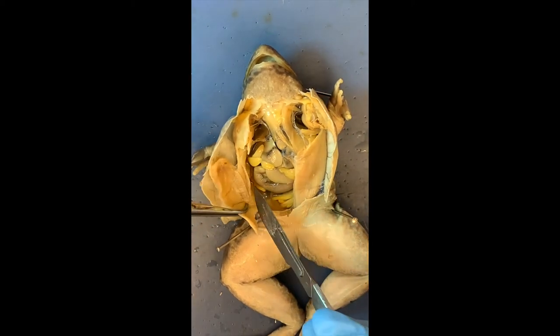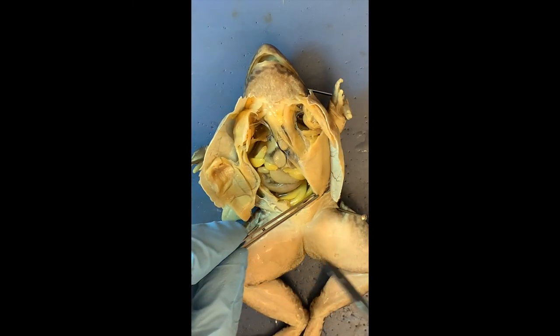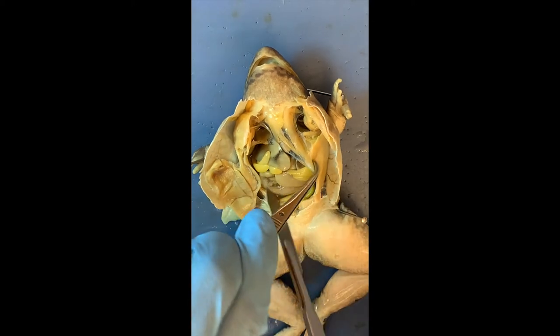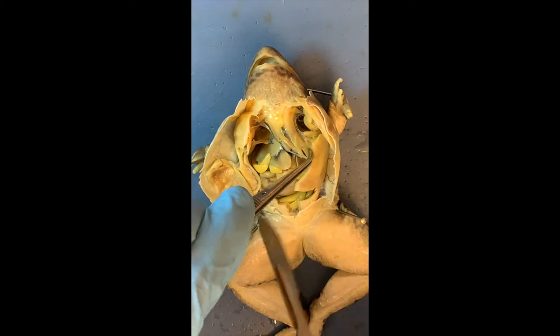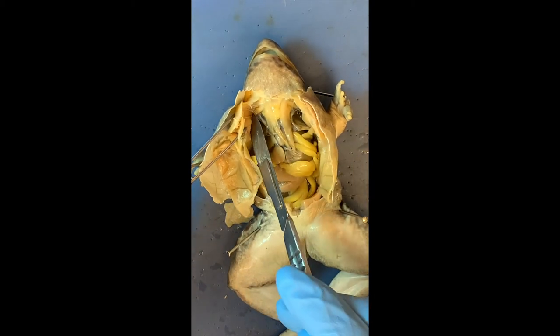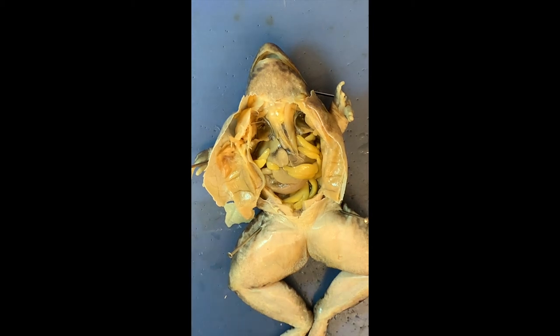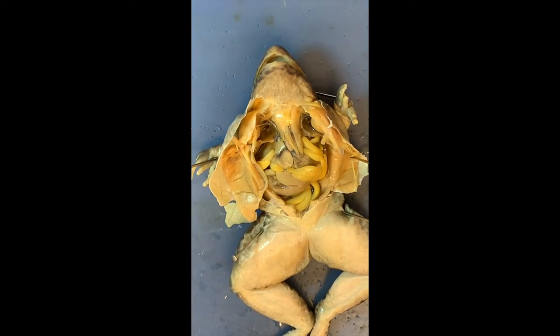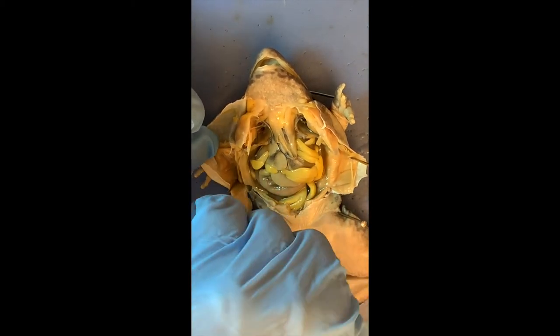There's a lot of yellow in there. Should we start explaining what those yellow things are? Those yellow mac-and-cheese noodle-looking structures, which are taking up a significant amount of room in the abdomen, are what we call fat bodies. Their sole purpose is energy storage. Whether you're growing, metamorphosizing, reproducing, or hibernating, frogs will use these fat bodies to get energy.